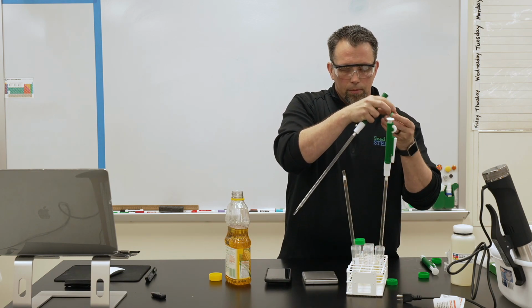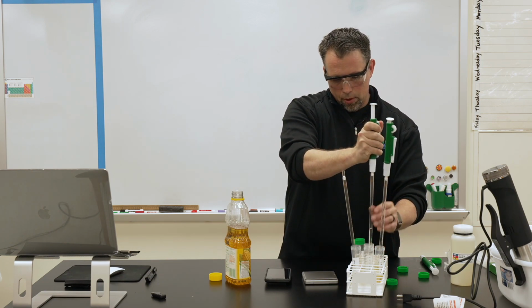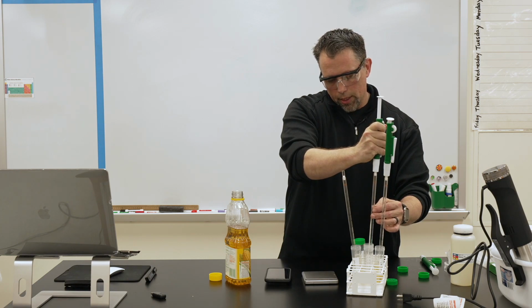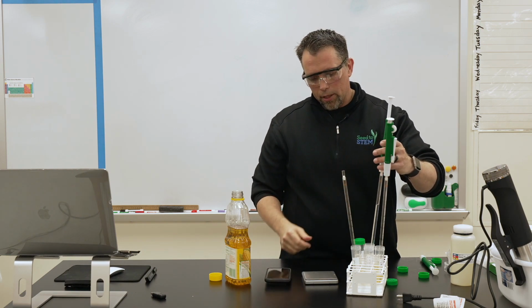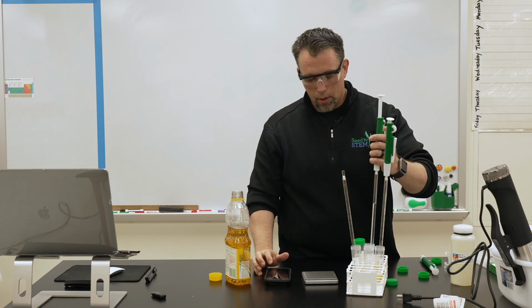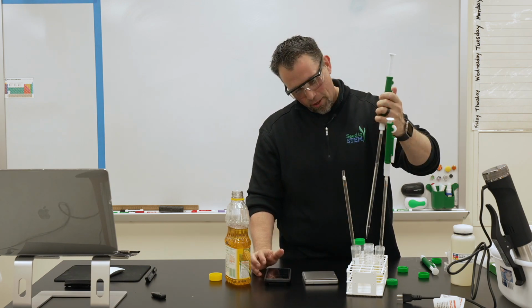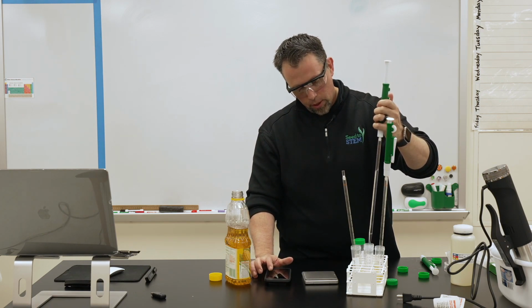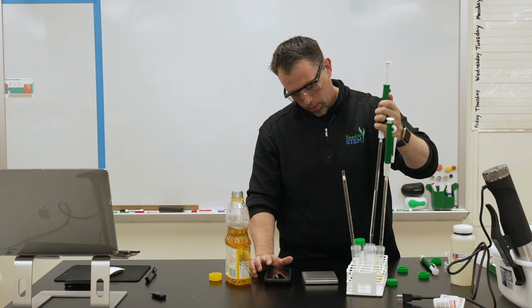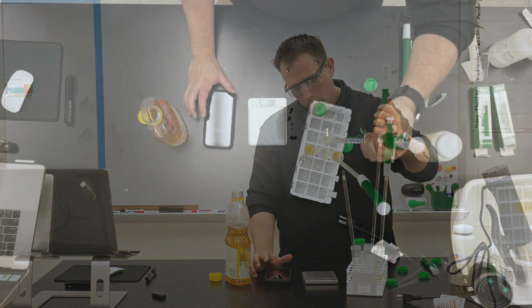I have this in the wrong one. This is the renewable diesel. Do the exact same thing, pull it up. One above the 0 is marked -1 right there. And sometimes it's hard to tell when the last drips get out, so it's easiest to go from -1 to the mark at 9 here. All right, so we'll do the same thing here. Going to reset it. So 4.43 was for the biodiesel. So 3.65 for the renewable diesel.